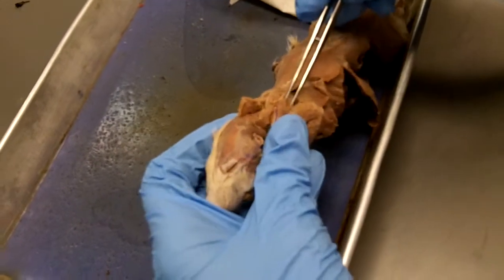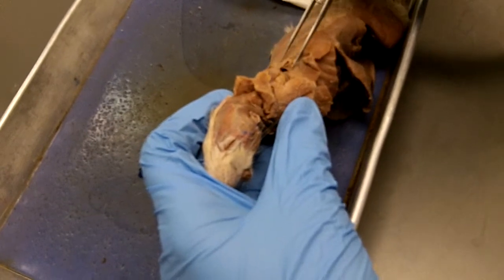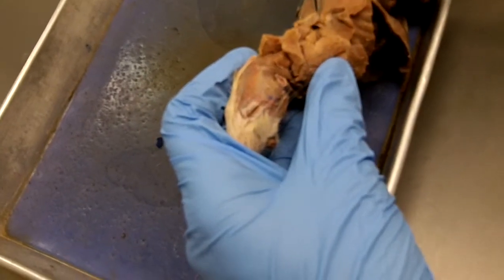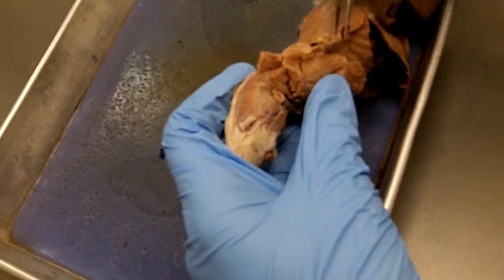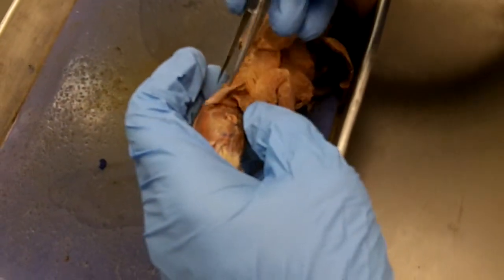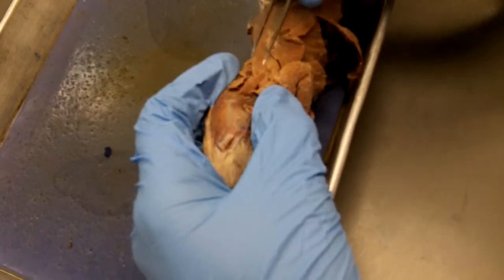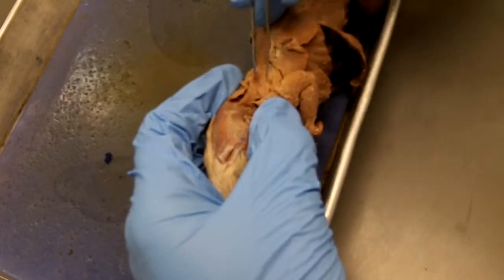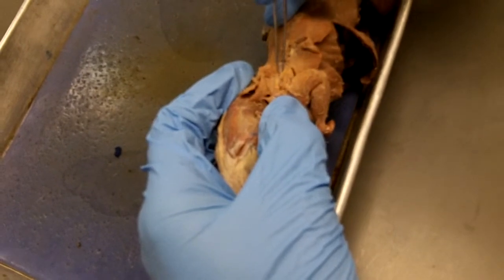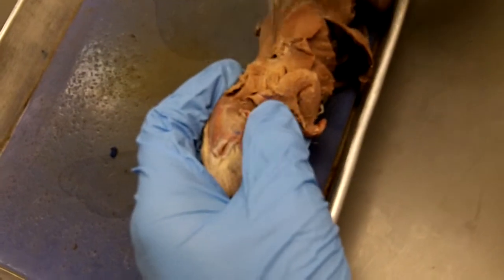Okay. All right? Now, if we look at the lateral aspect of the scapula. And where's the teres major? That's what I was going to show you. Oh, okay. So we're going to pull this, the thoracic trapezius and the latissimus dorsi, back out of the way. In fact, I think we'll just separate them where they go in different directions. Pull that back out of the way. We're pulling cervical trapezius down out of the way. And here's rhomboideus capitis. Underneath that is this large muscle, which is above and anterior to the scapular spine, and that is supraspinatus.